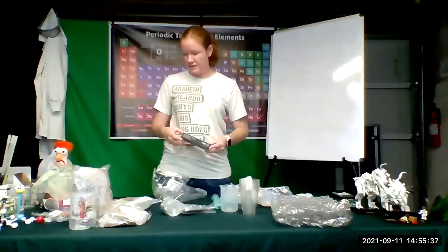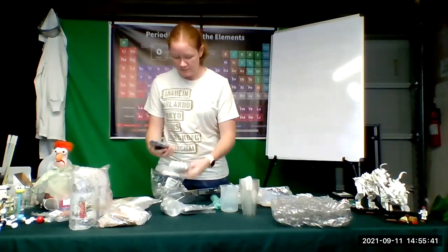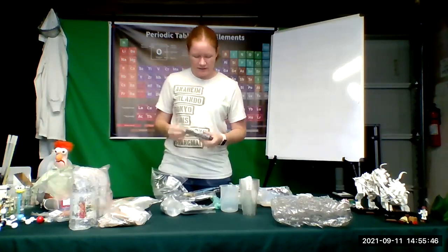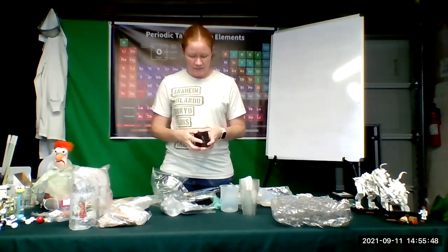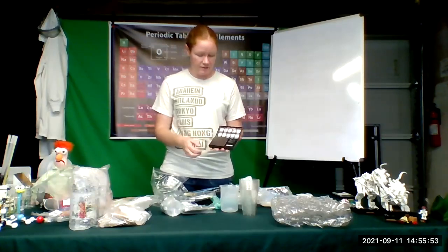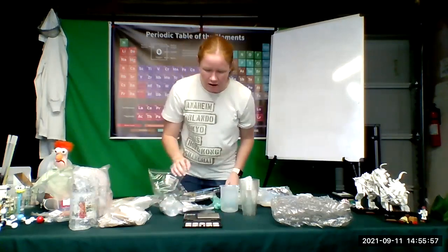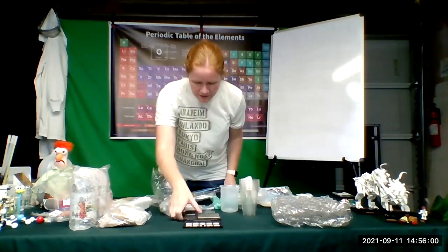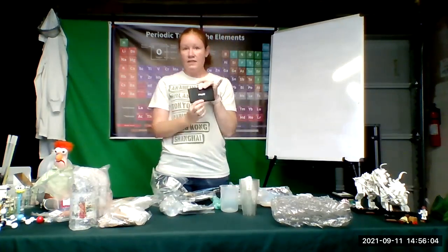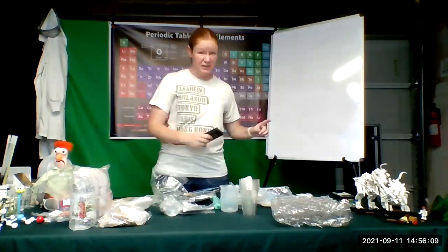Okay, so this one that they sent me this time is slightly different than the one I showed you guys before. So this one is done by AWS, it looks like. It's not written Carolina on it, but it'll work the same way. So in this one, it looks like you press the button and open it up. Yeah, and so there's your little scale. And so you'll put it down and you'll turn it on or off. Okay, and then you can use your scale. All right, so this is what you'll need right away for you to do your percent error from our previous experiment.